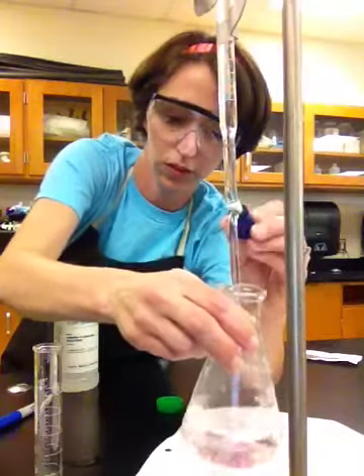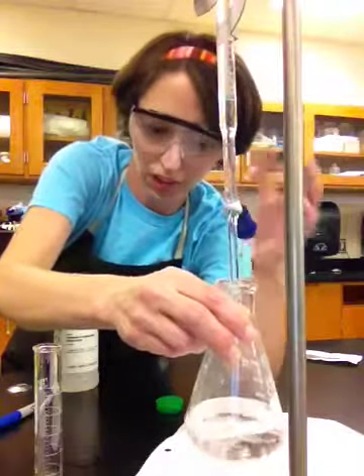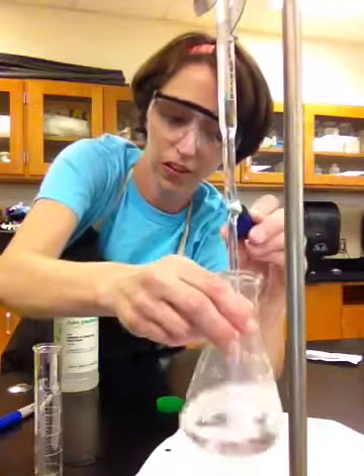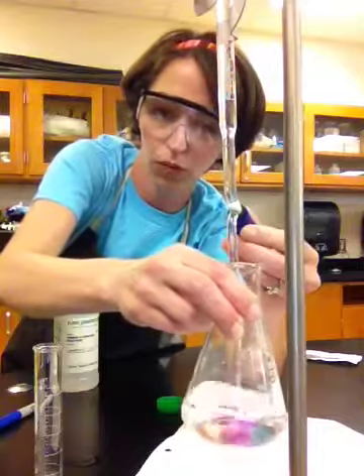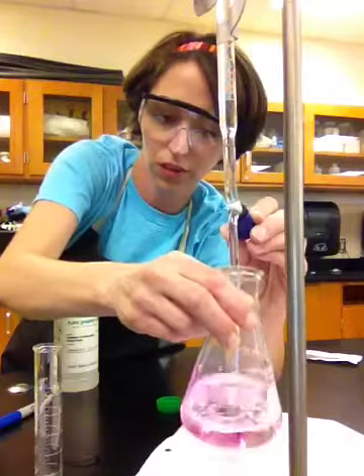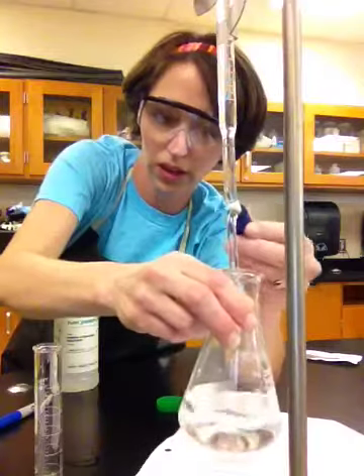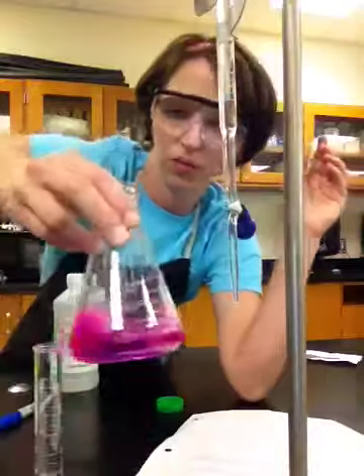Ooh, we're getting close. Now, those of you guys that are going into AP Chem, you will do like a million titrations. You will get super good at titrations. And even in biology, AP Bio, they have a couple titrations. Whoa. Guys, see how that pink is sticking around? Whoa, man alive. Okay, now that is most certainly pink.